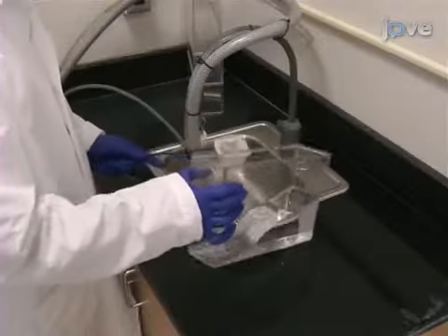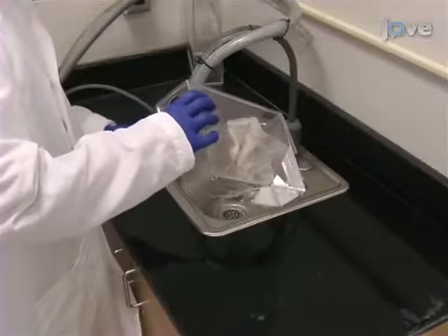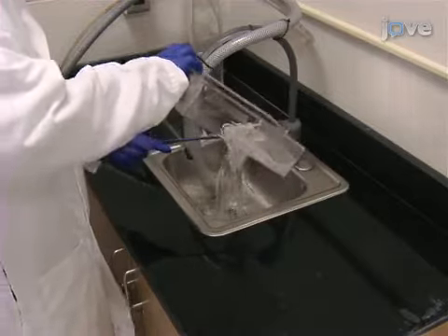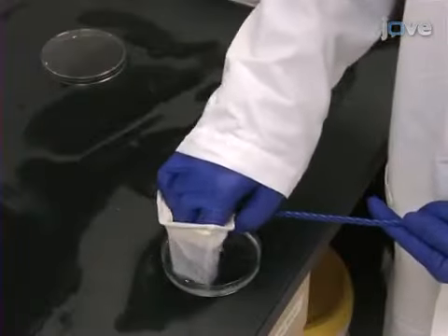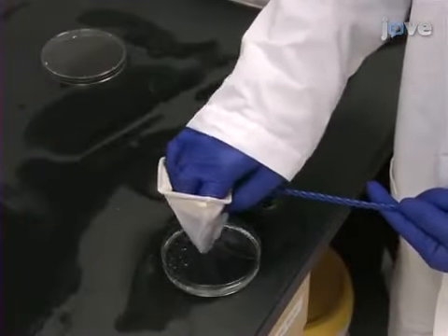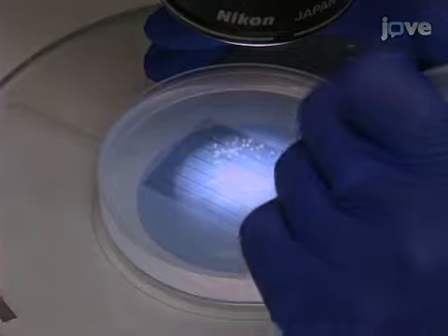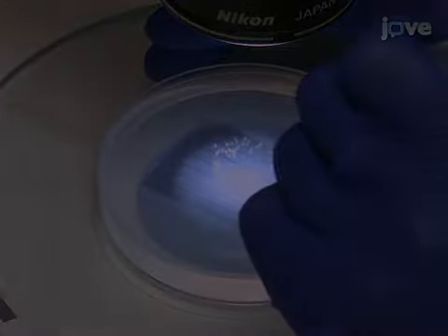To perform global morpholino, or MO, injections, collect embryos immediately after fertilization and load them into an injection plate.